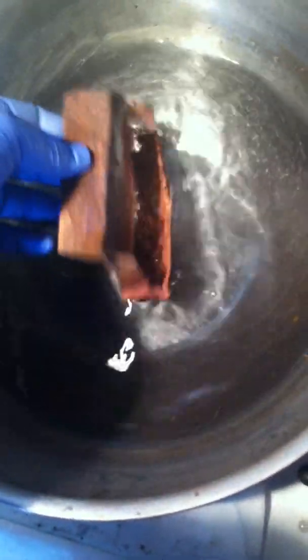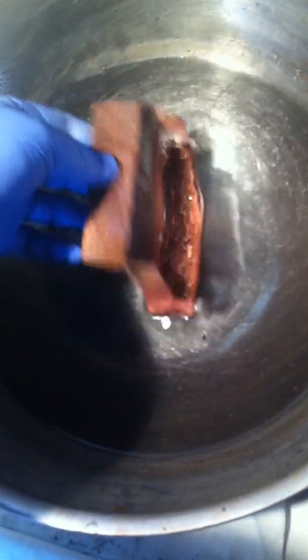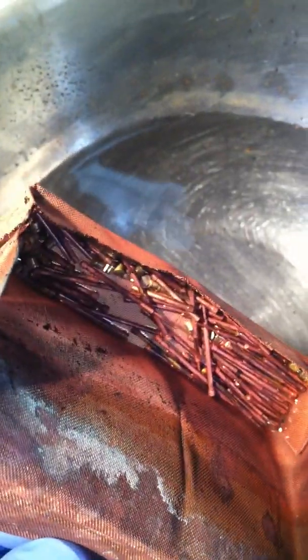That will do it. I've got a big stainless steel bowl here with a couple liters of water. I'm just going to rinse this off — a little shake. I just want to get any of the gold off that's still on it, any powder that sticks to it. See, it's the same color as the basket now. It's not gold anymore. But with the naked eye you can see that that's all copper now.